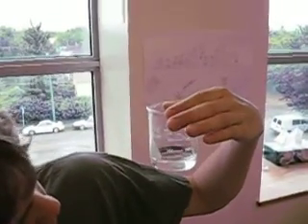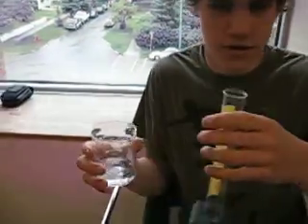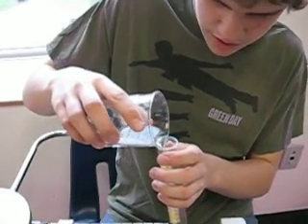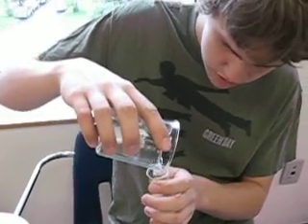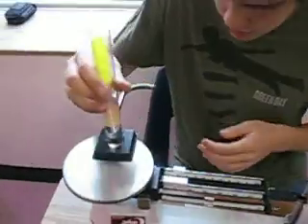Now we got 15 milliliters of alcohol — probably isopropyl alcohol, not the kind you drink. Then we add that to the graduated cylinder. And now we weigh it again.